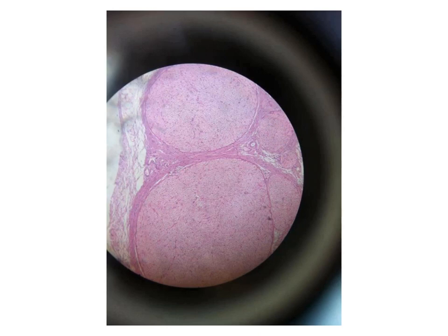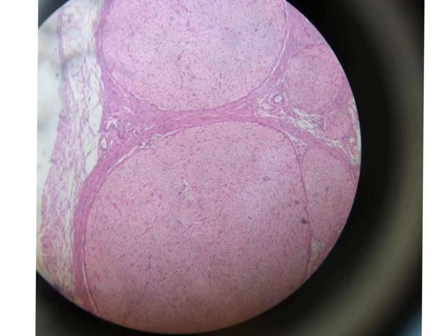This is the section in the nerve trunk. And here we have the perineurium, and inside each bundle we have endoneurium in addition to the nerve fibers. If you look here, you will see these circles. Each one represents the nerve fiber transversely cut.